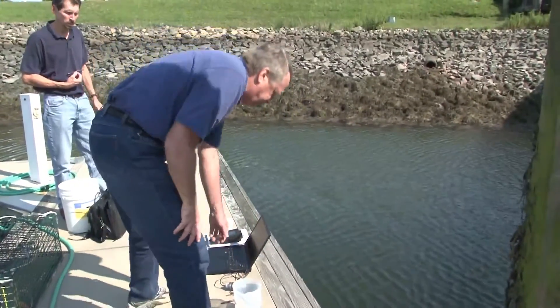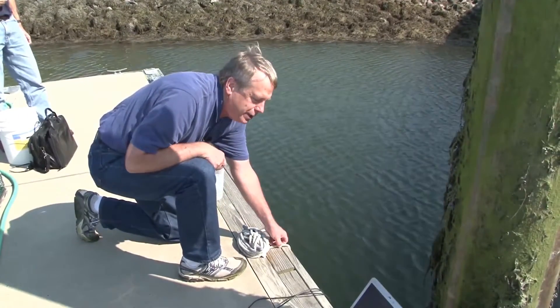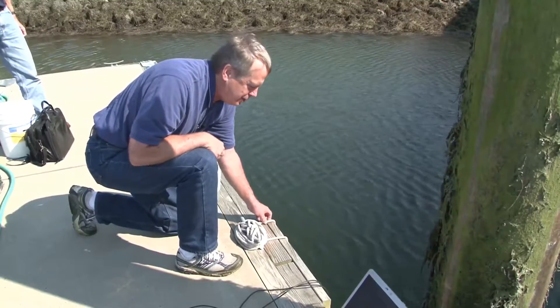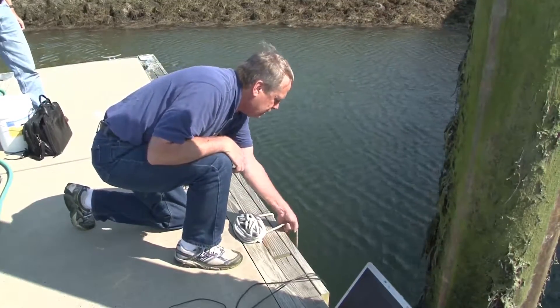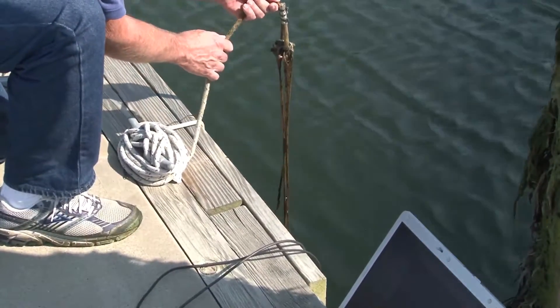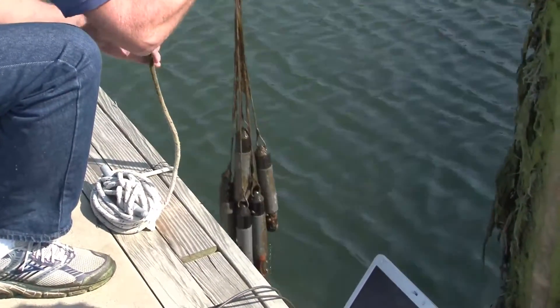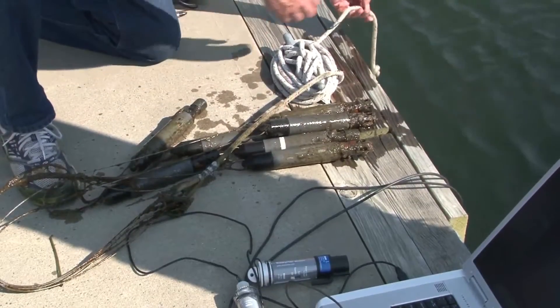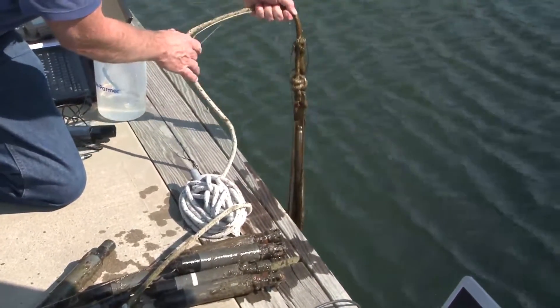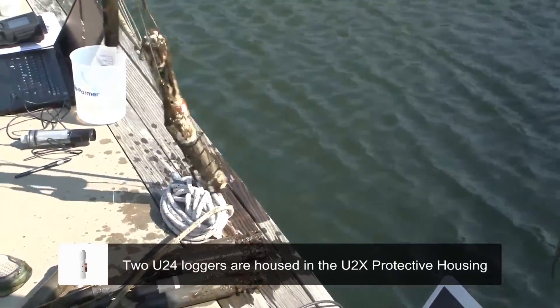Now we will pull up the loggers. We have deployed a DO logger, the U26 DO logger, and the U24 conductivity logger, because we need to know salinity for the same calculation that the meter did in order to calculate the actual DO content in salt water. As you can see, there's fouling — marine growth on the cable and a bit of growth on the loggers. There are DO loggers and on this cable a variety of conductivity loggers, all suitably fouled with marine growth.